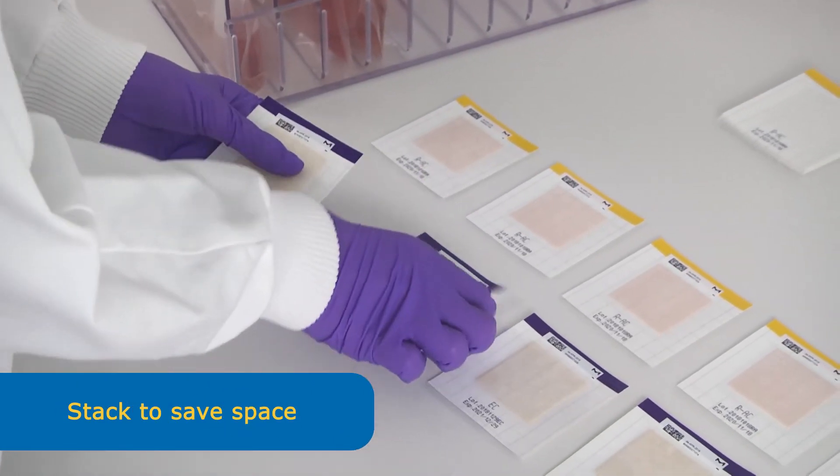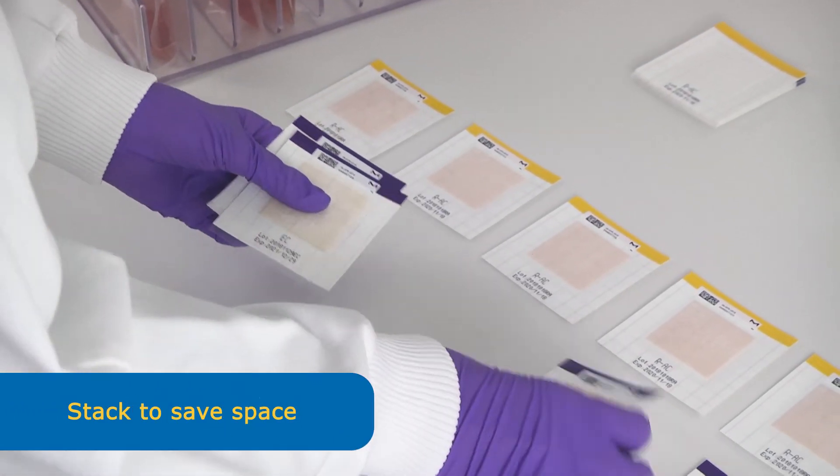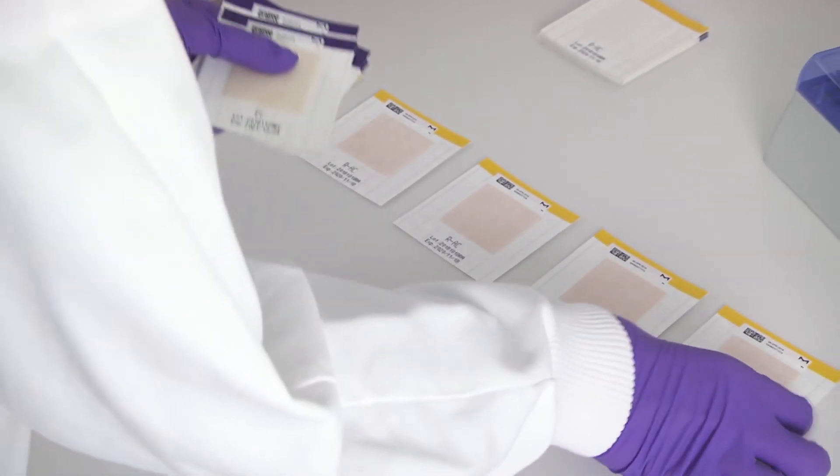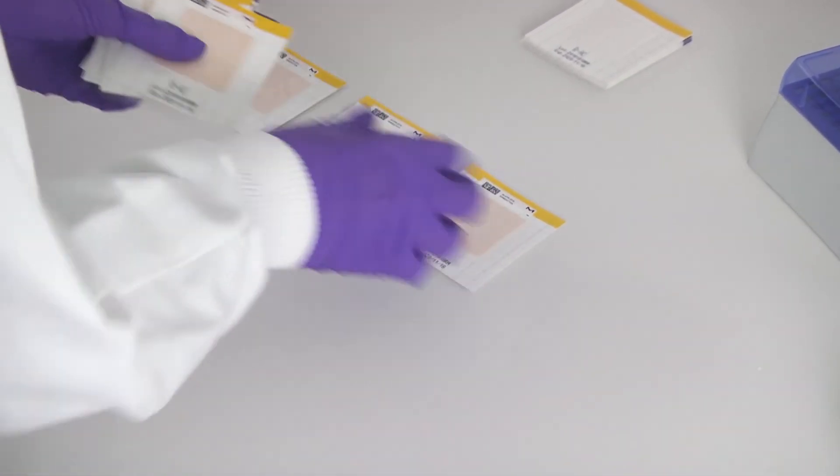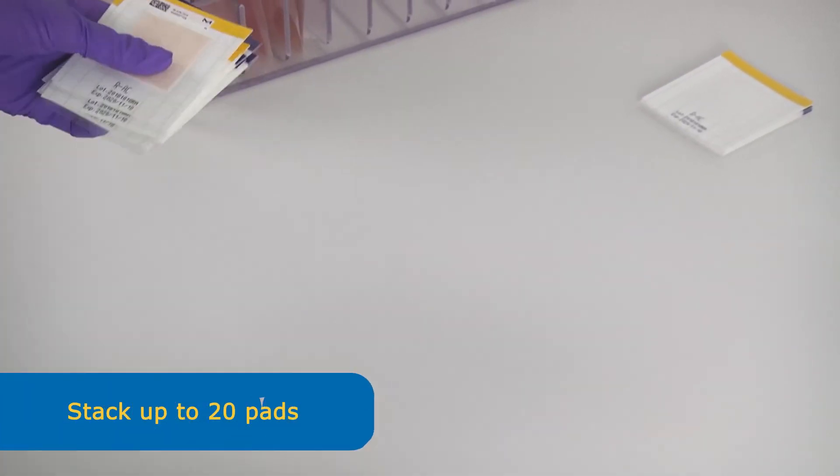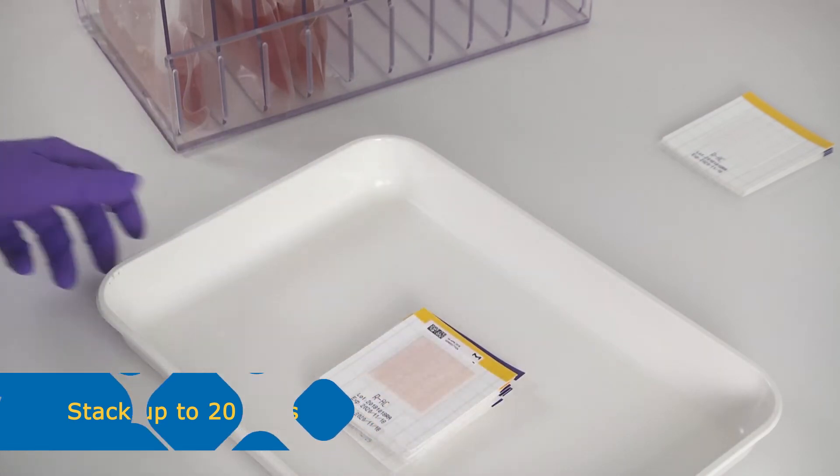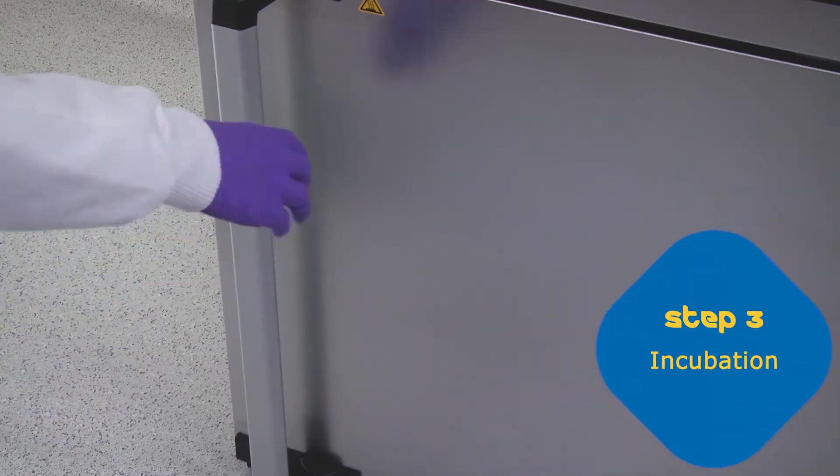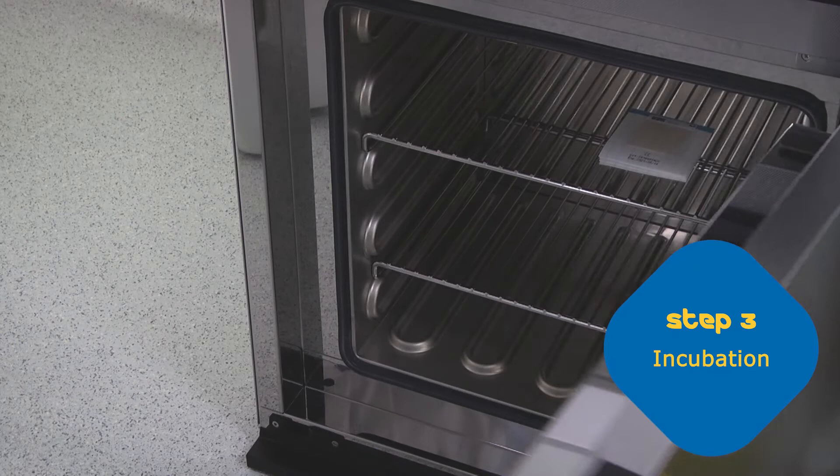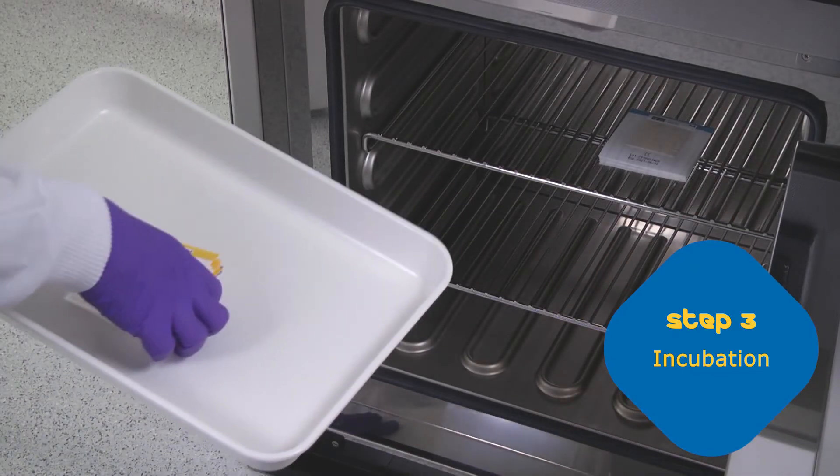To save space in the incubator, the MC MediaPad tests can easily be stacked. We recommend to stack up a maximum of 20 pads to ensure safe and proper handling. Place the stacked pads in the incubator with the sample area facing upwards.